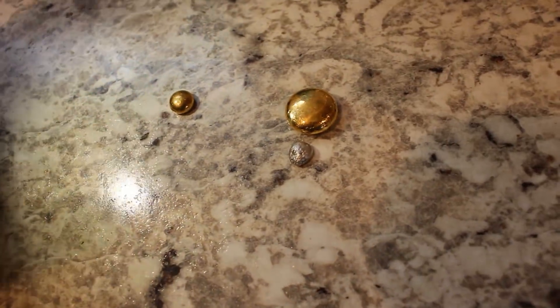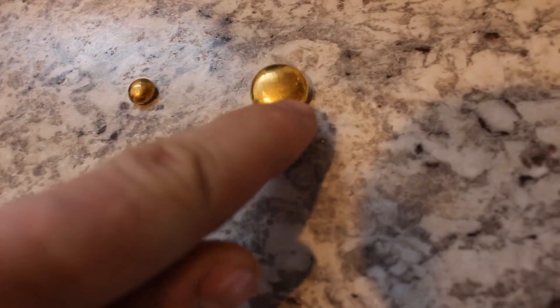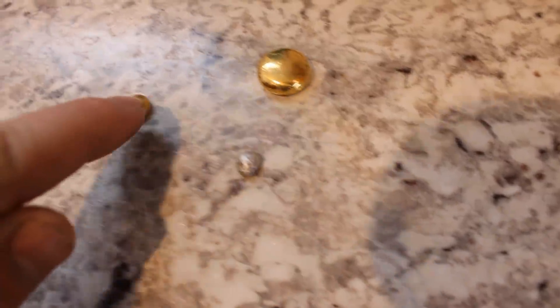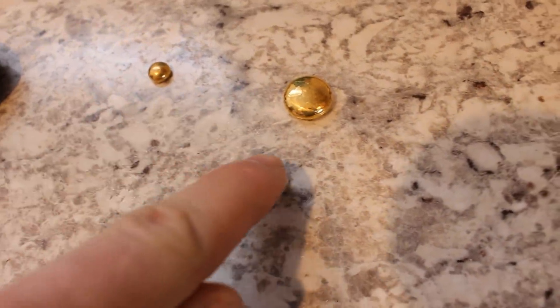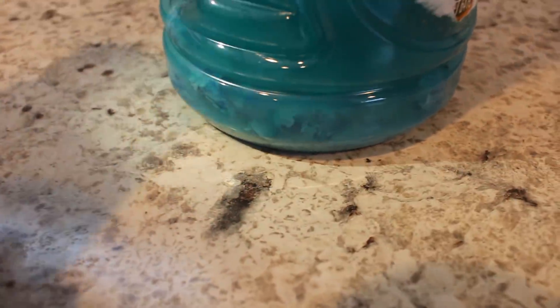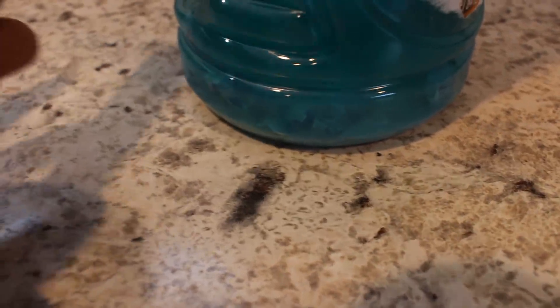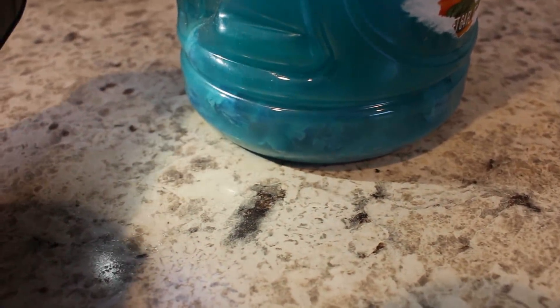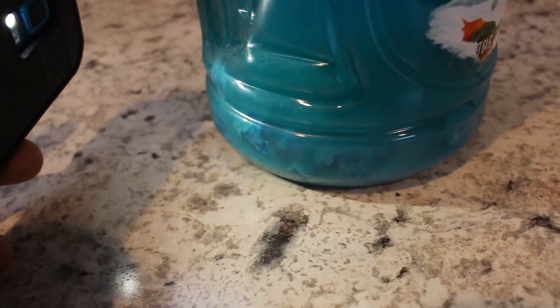Very nice. Here's what I've gotten so far. I took that little blemish out of this bead by putting it in some hydrochloric acid and dissolving the rust away. This is the bead I got last episode, and here's a little piece of silver. It's much less silver than I was expecting — and I was confused about that until I looked over at my waste jug. There's some silver chloride in the bottom of it, so what must have happened is the pH was too high for the silver to drop out, and when I poured it off into the bigger jug it all settled out. There's probably quite a bit of silver in there still — at least I know where it is and I'll extract it eventually.